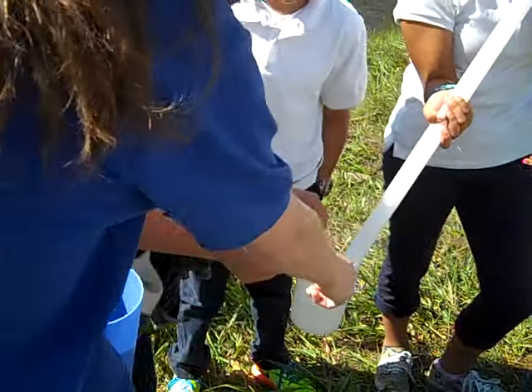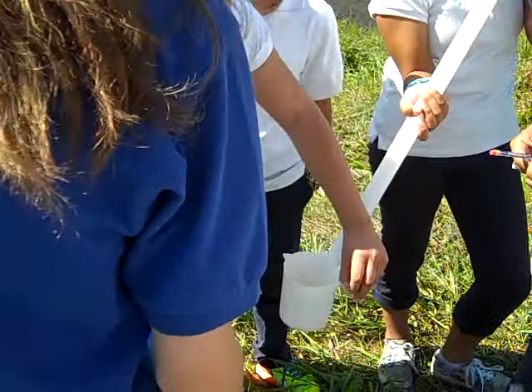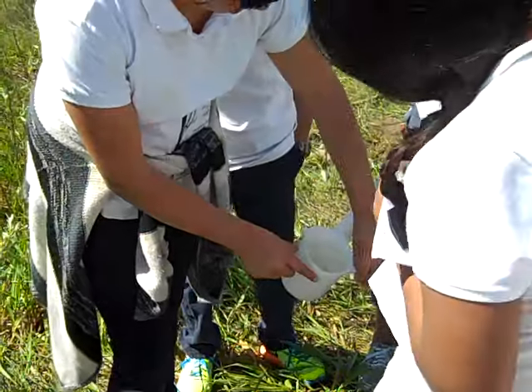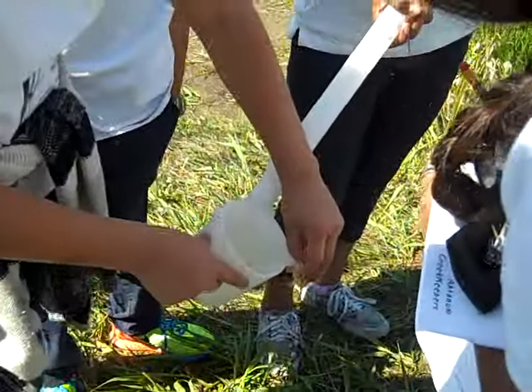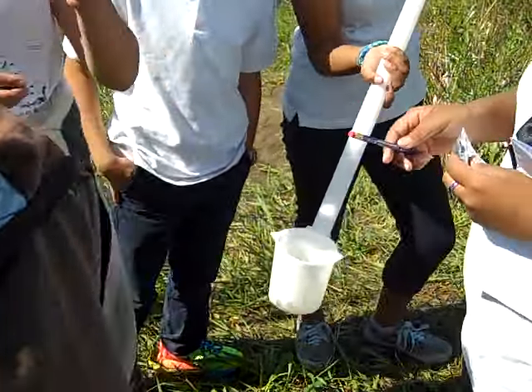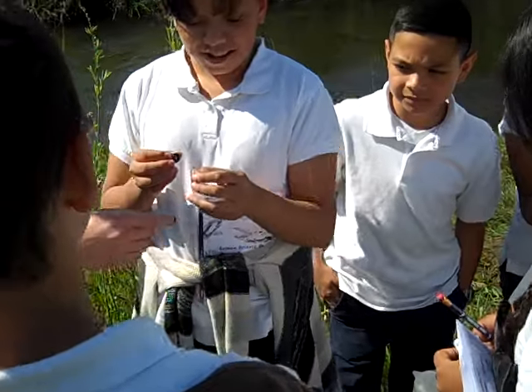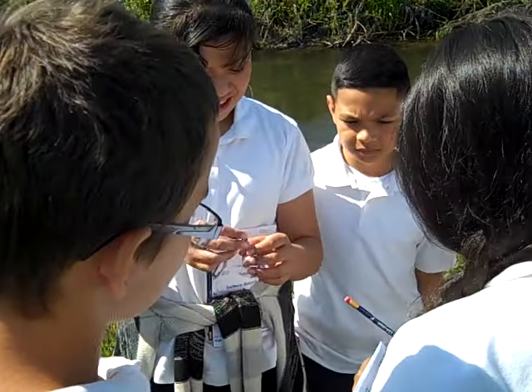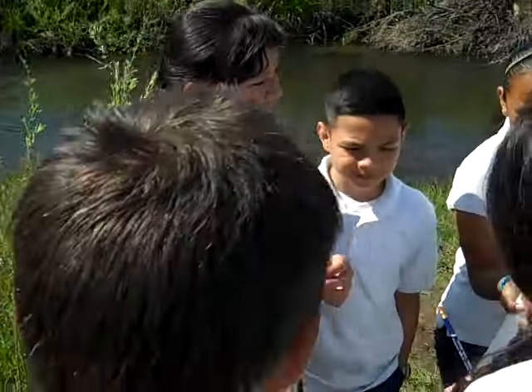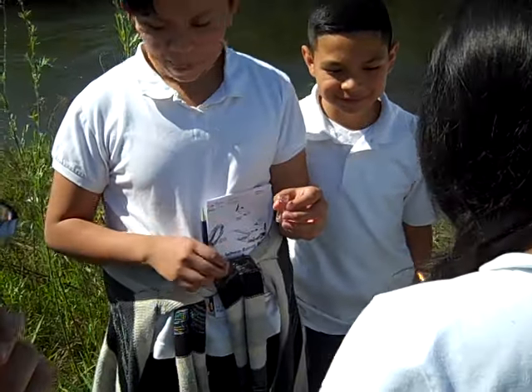Or no, you can use this to tip it. Stop. Okay. Sorry, we're gonna add 2. I forgot. A little bit much. We're gonna add 2 tabs, so we need one more too. One more. There we go.